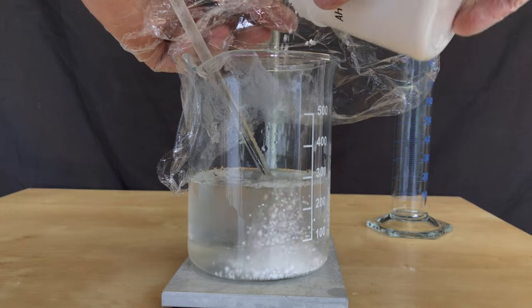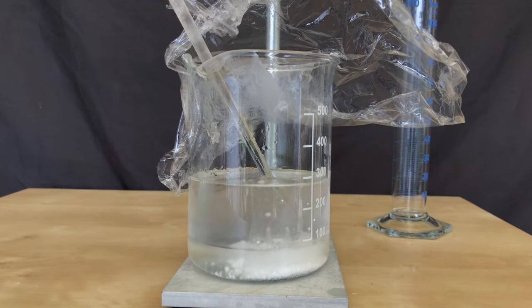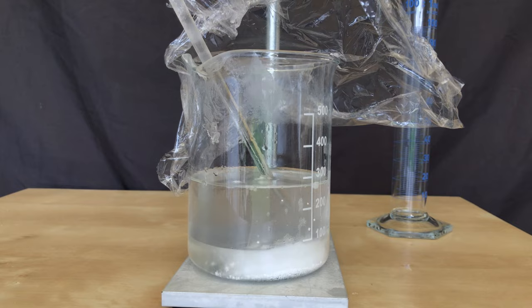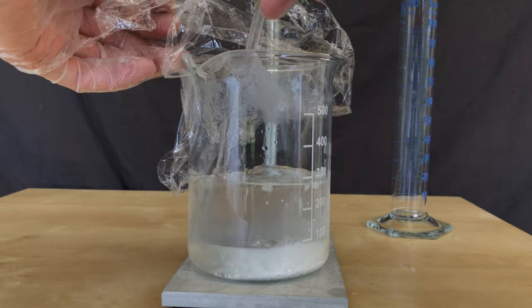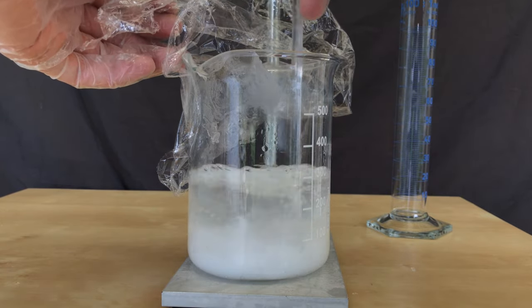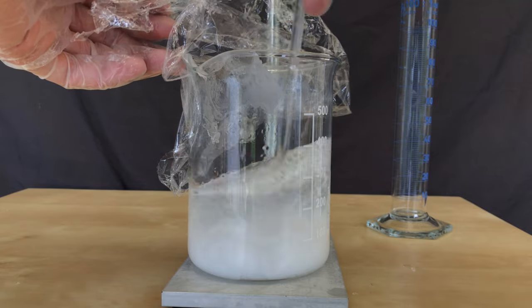To dry the ether even further anhydrous calcium chloride was added. It dissolved in the water and should get rid of some more water dissolved in the ether. It won't be perfect, but the amount of water that will stay behind in the ether will be minor.